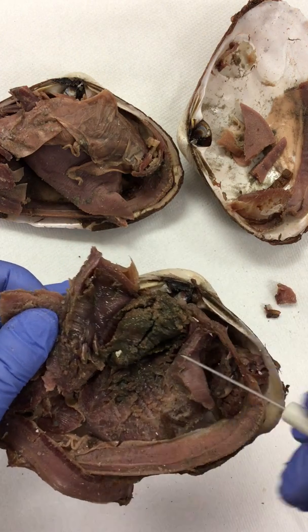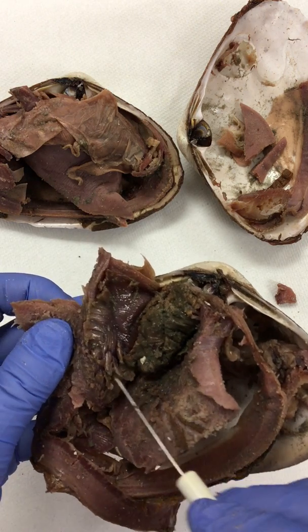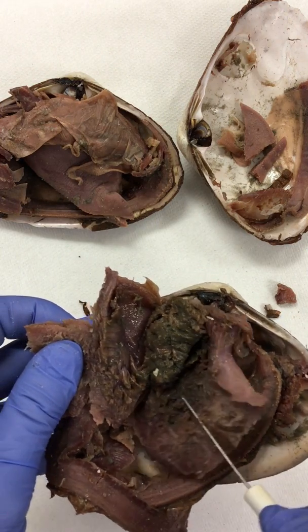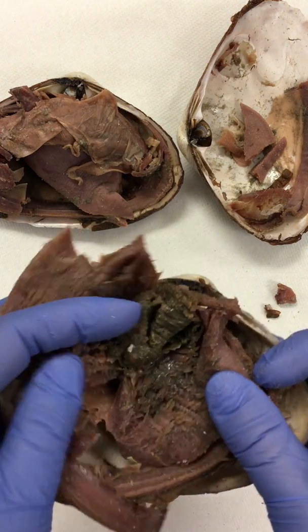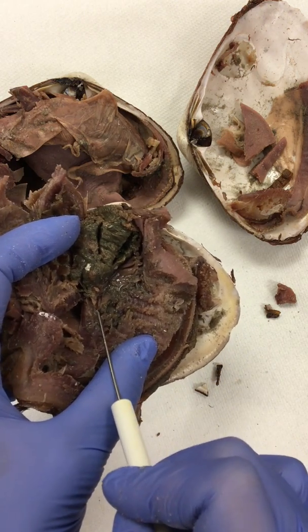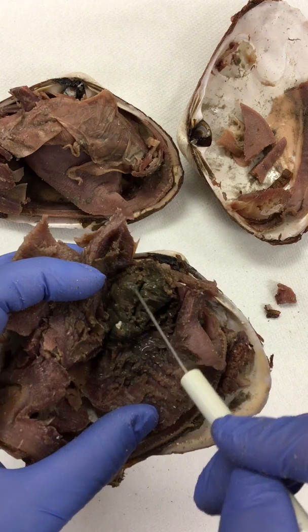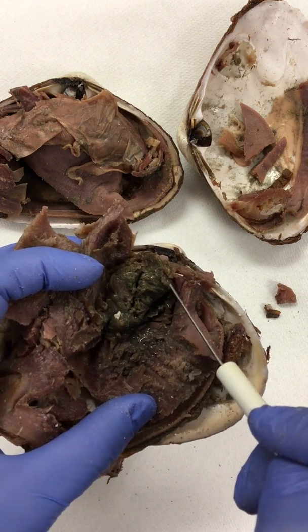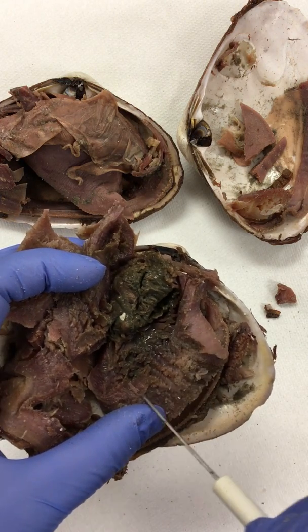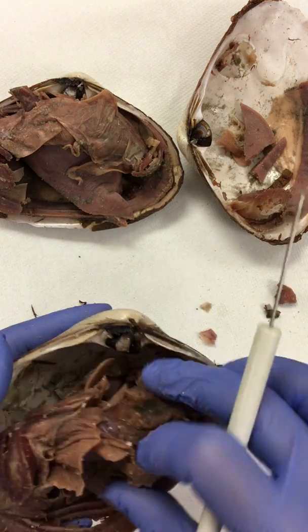Depending upon the specific species of clam, you'll be able to see some intestines more clearly than others, and some will be larger and some will be smaller. So what we're going to do is look at the intestines on another clam. They're not as clearly seen here, but you can note that there is a small tube that runs right back here in that area. The food's going to come in, it's going to pass through the stomach, which the digestive gland circles around or encases. Then it's going to travel through the intestines, which kind of wrap down here, and then the intestines come back up to the more dorsal region of the clam.